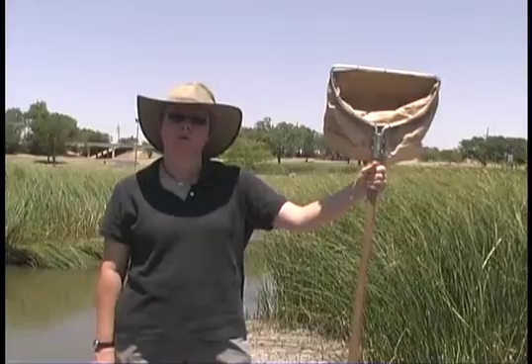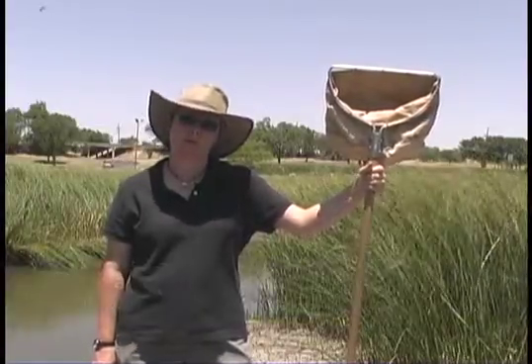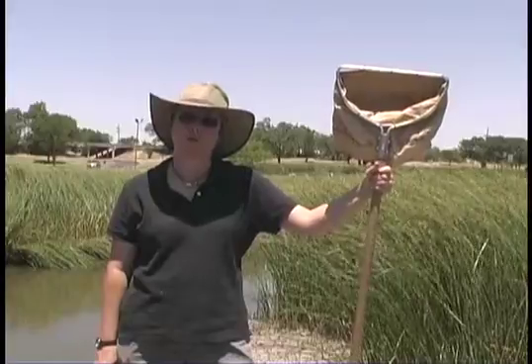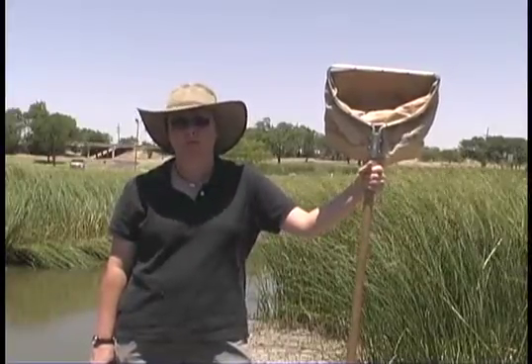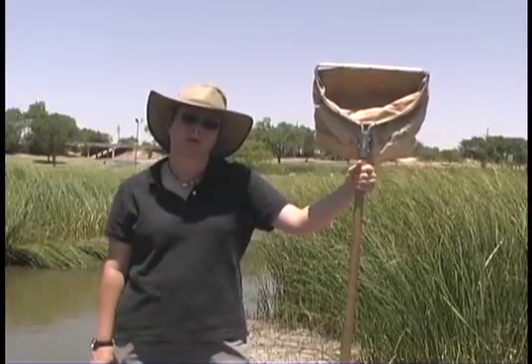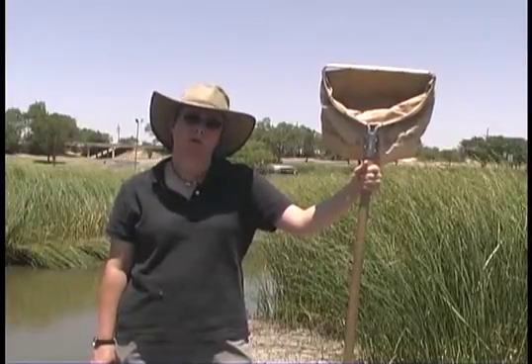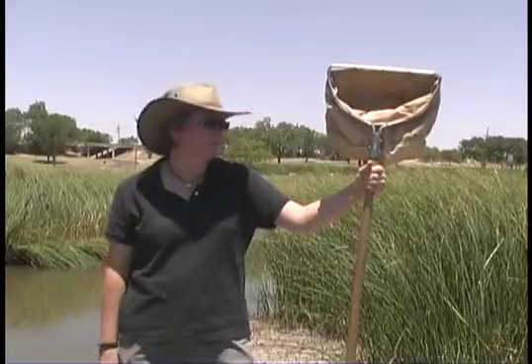I'm going to demonstrate some ways of sampling aquatic arthropods today. There are several ways of sampling them, and several things you need to keep in mind when you sample. The first is which groups you wish to sample. For example, if you're interested in mosquito larvae, you'll want to sample at the water's surface. But if you're interested in odonate larvae, you're going to want to sample on the bottom of a body of water.